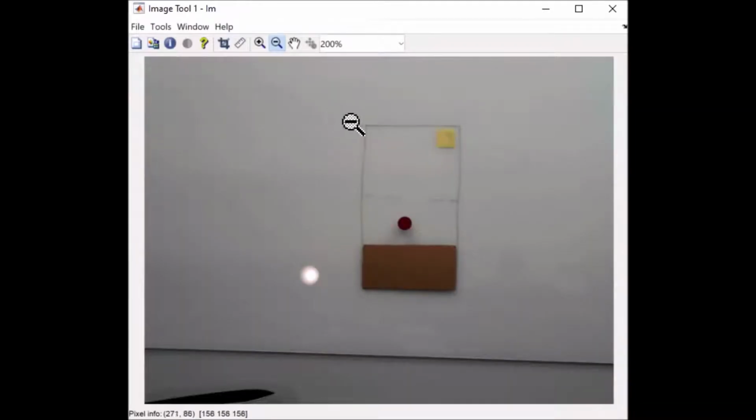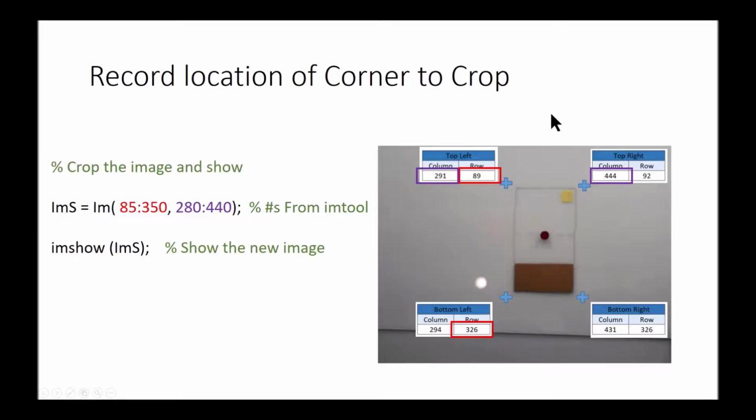The first way I'm going to do it is I'm just going to hover over different spots, see where I'm at as far as location. If I go right there, I can see that I am in the X and Y coordinate and that this is my 290th column and 86th row. This is my 433rd column and 330th row. I'm going to record those in Excel so I can use them to make decisions later.